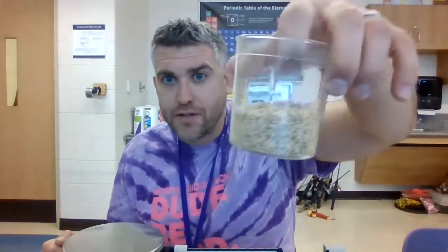You are going to get 7 types of substances in which you have to find the mass of. In each substance, I have already pre-poured them for 100 mils, okay? And so there's 100 milliliters of each of these substances in here. Let me introduce the substances. You have these pinto beans, sand, like playground, salt, wood chippies. This is like the stuff that you would find in a hamster cage. Birdseed, water, and vegetable oil.